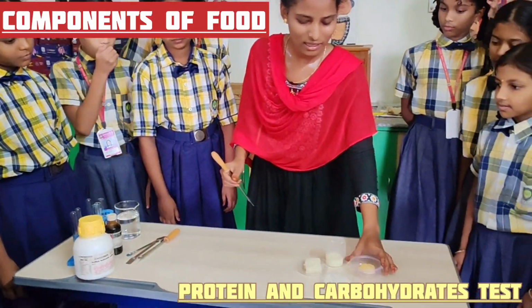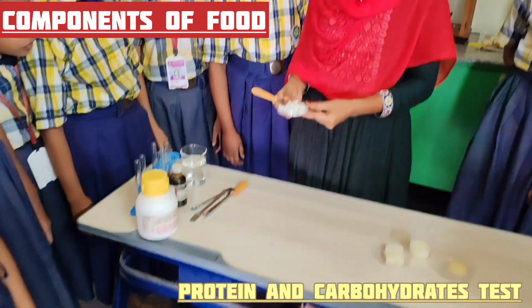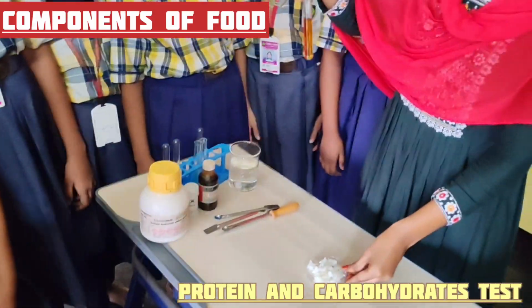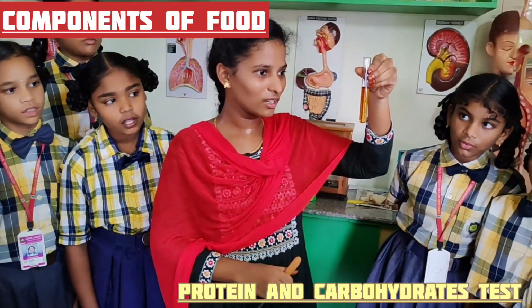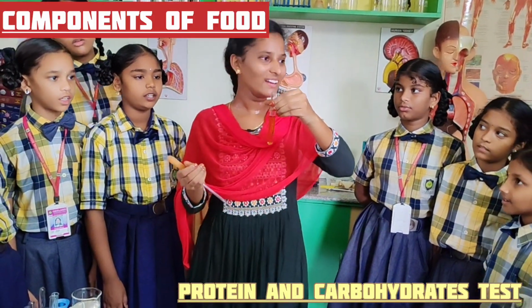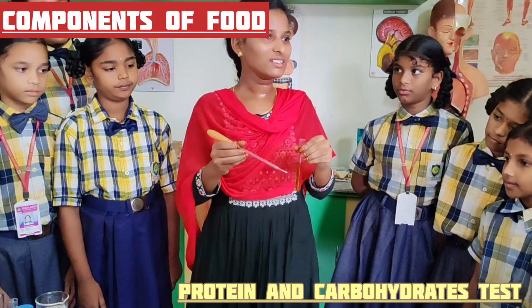Now, I am taking rice. This is cooked rice. Okay. Now, I am taking iodine solution. What is the color of iodine solution? Orange. Brown, orange or light yellow. Okay. What did I tell you?